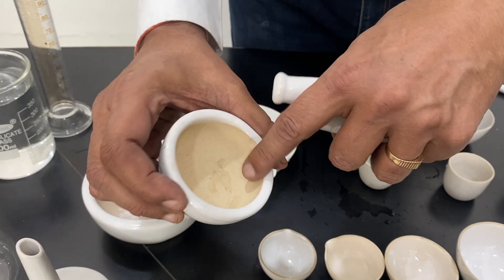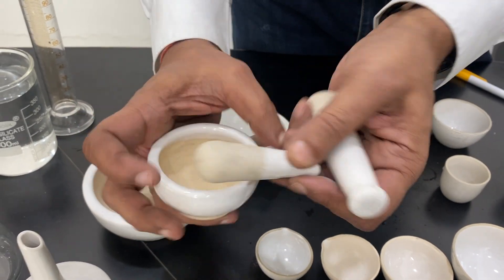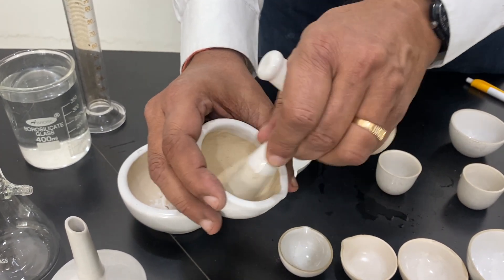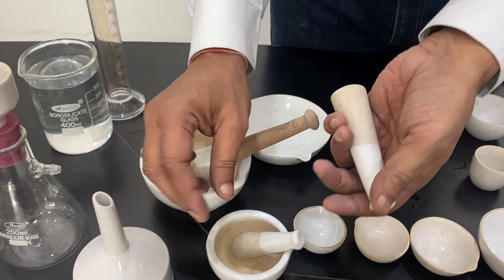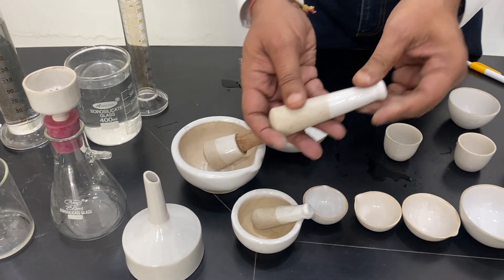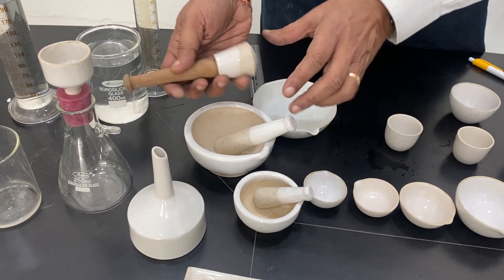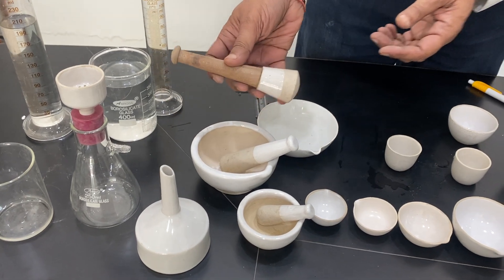This one is enamel — the lip is enamel. It comes with the pestle and is used for grinding the product. It comes in smaller sizes of 2 inches and 3 inches with a porcelain pestle. The bigger size of 6 inches may come with a wooden pestle, depending on the need.